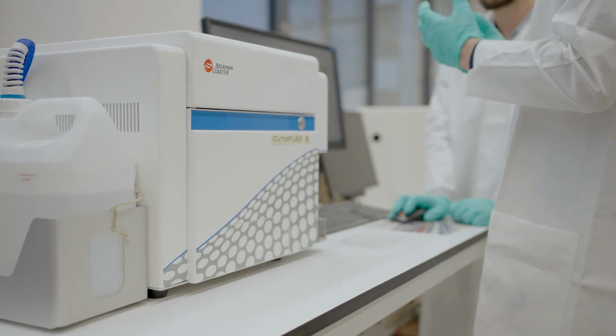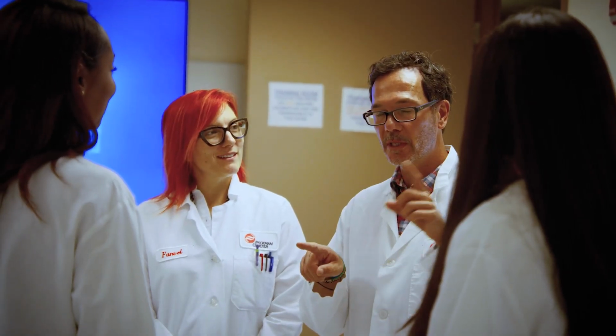Additionally, CytExpert for Spectral stands out as one of the fastest and most user-friendly options available. It's a benchmark in the field, balancing simplicity, functionality, and performance. The software also offers flexibility in spectral unmixing, allowing users to choose between different algorithms to cater to a variety of research needs.